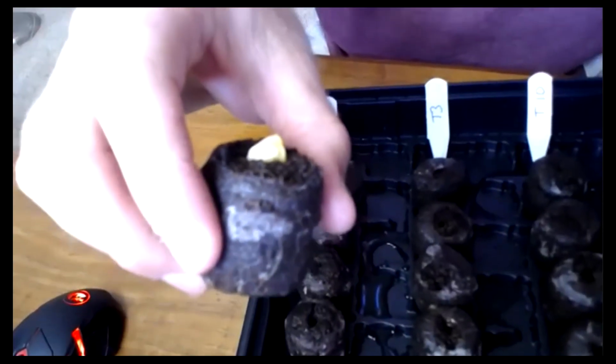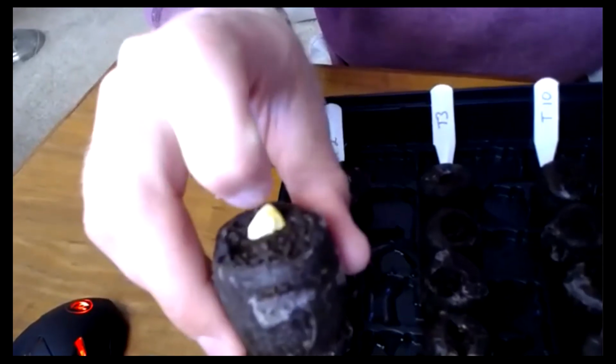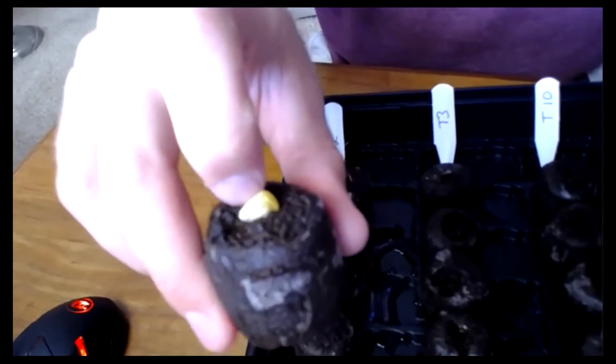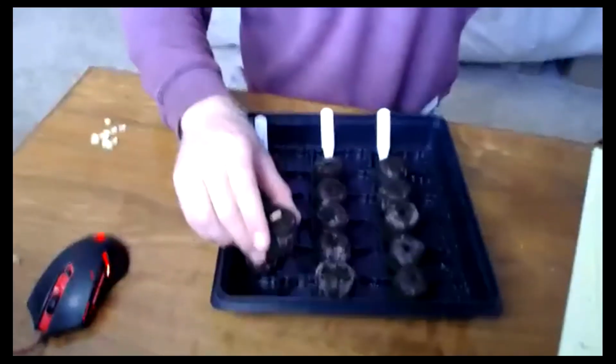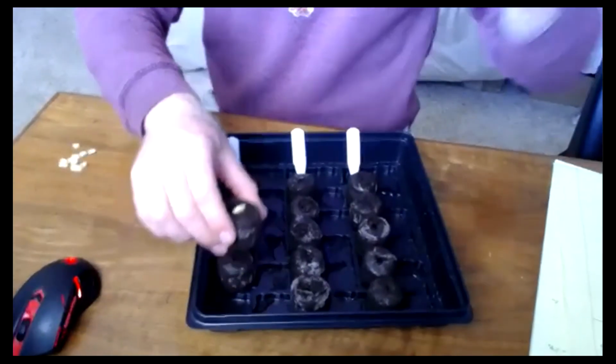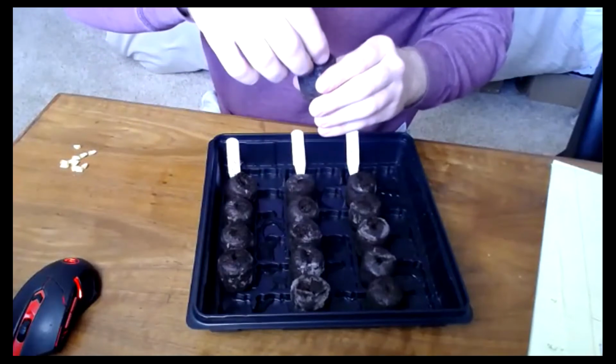I'm going to make this image quality a little nicer. So that's it. We're just going to point that embryo facing the same way on its side, and all of them will face that same uniform direction. All right, I'm going to continue on. So everything in my treatment 2 row ends up looking about the same.